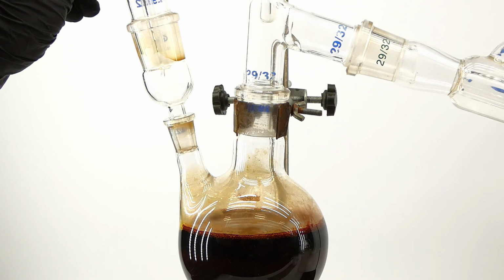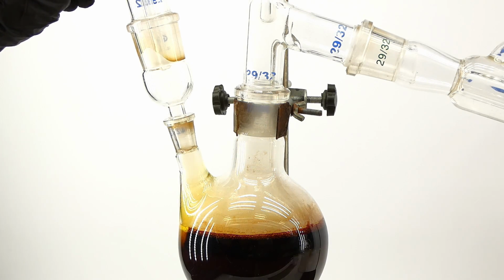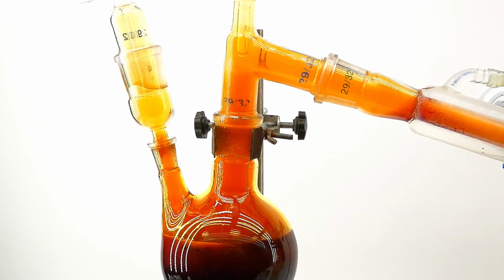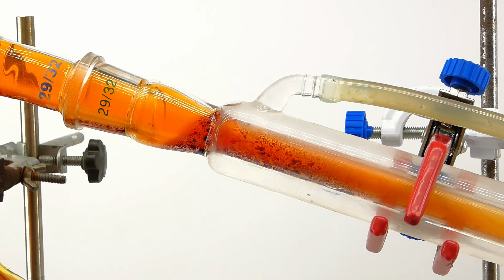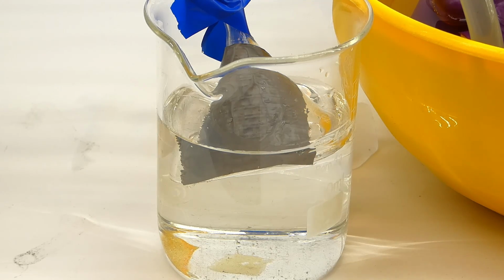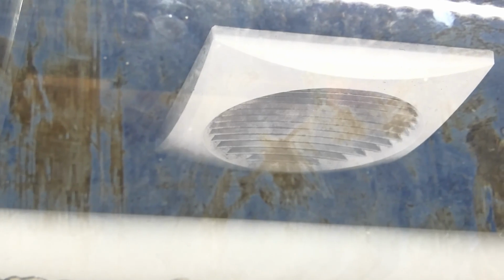Immediately after the first drops of sulfuric acid hit the mixture, a lot of orange bromine vapors started rising from it. At first they didn't distill over because bromine can dissolve into the water, giving it this red tint, but when its solution gets saturated, the vapors start climbing up the apparatus and condense in the ice-cooled condenser. As the pressure inside the apparatus increases, some of the bromine vapors escape and end up in the trap, which does a good job of neutralizing them, but to be absolutely safe, I had my fume hood running all the time.